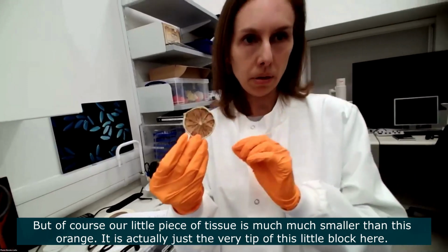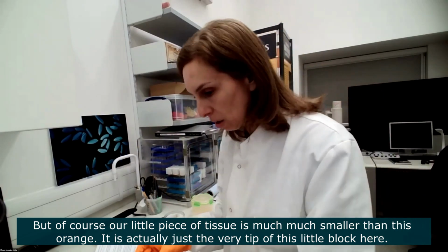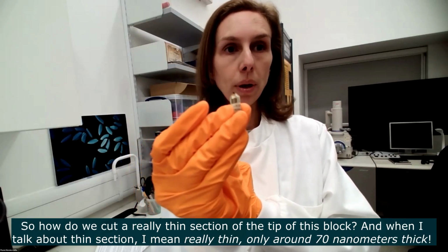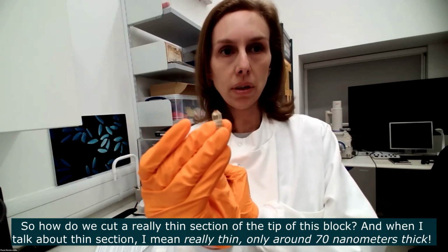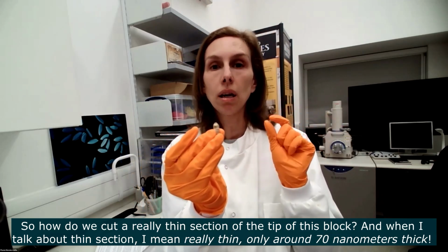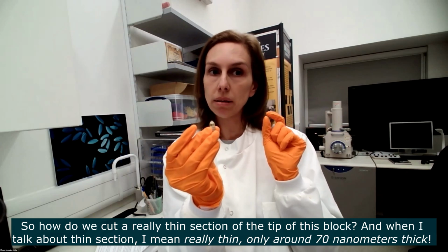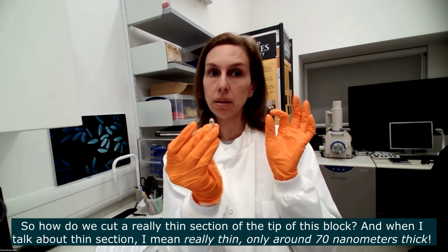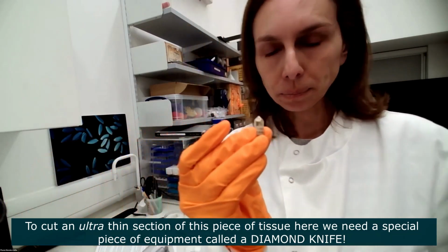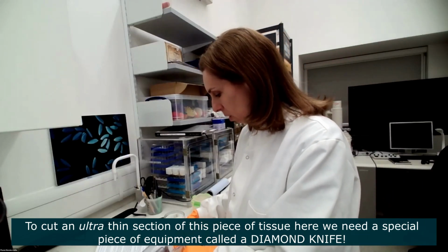But obviously, the piece of tissue that we have is much, much smaller than this. So it's our nice little block here. And it is actually just the very tip of this little block. How do we cut a very, very thin section of the tip of this little block? And when I talk about thin sections, I'm talking about really, really thin sections. So this is in the nanometer scale. The sections we look at down the electron microscope are about 70 nanometers in thickness, 70 to 90 nanometers regularly. To cut a section of this very tip here, a section that's this thin, we need a special piece of equipment called a diamond knife.